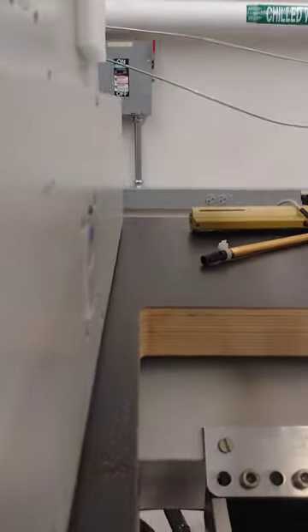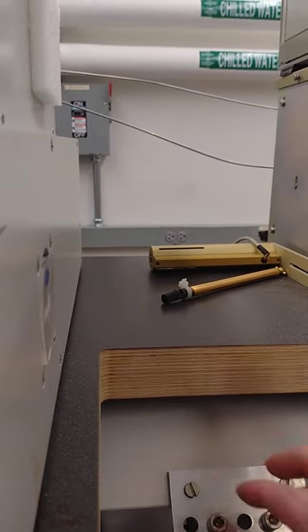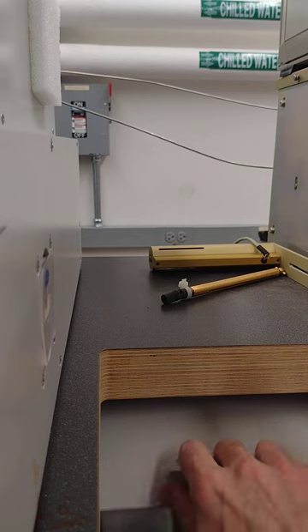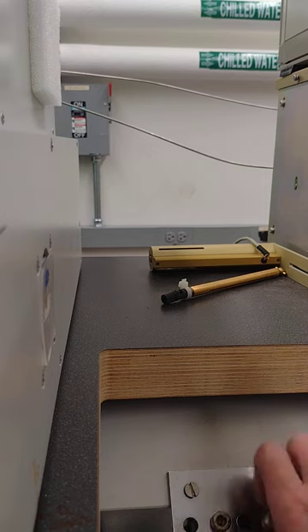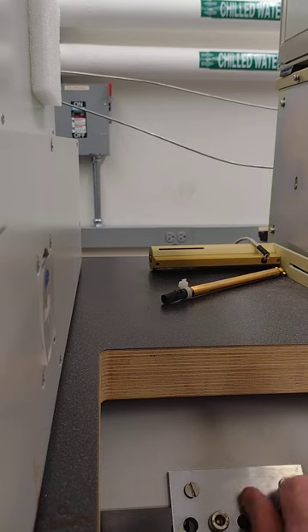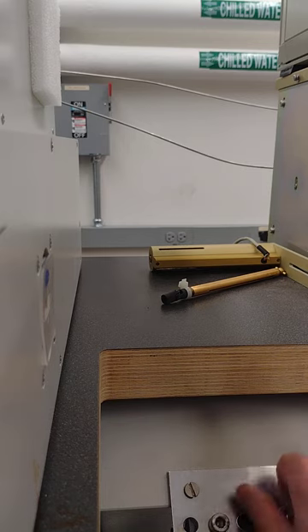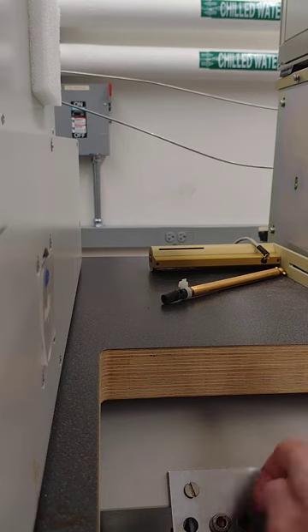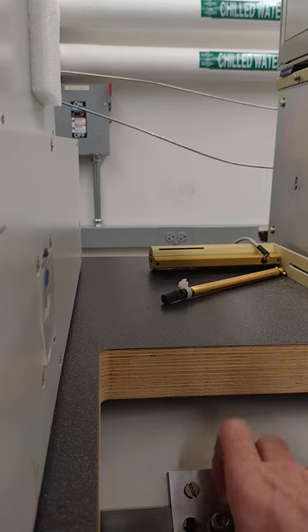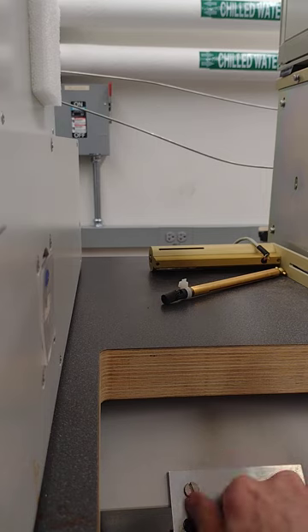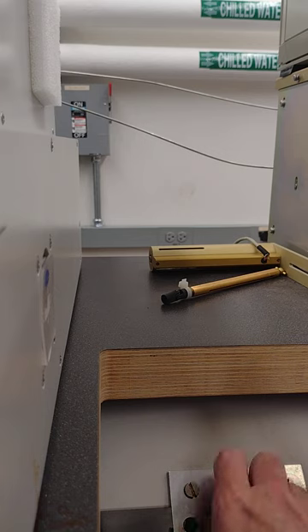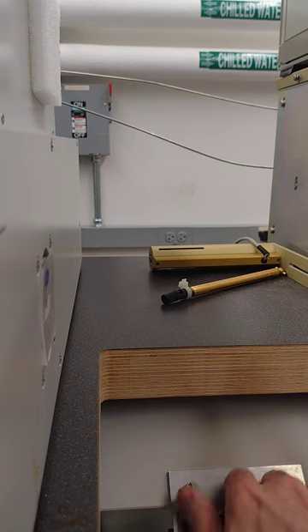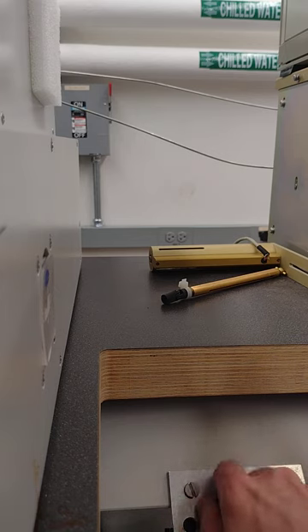I'll try to lean up this camera against the bridge, but basically you can loosen these 6 millimeter bolts and remove this whole stabilizing arm. You know, you don't really need to remove this, but it's good to have it out of the way.